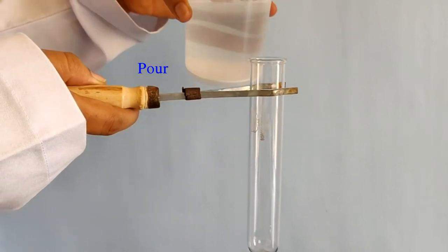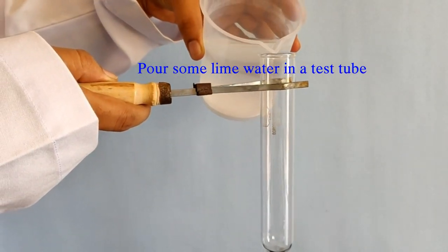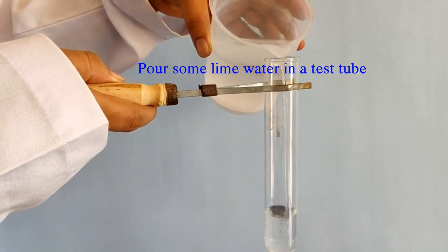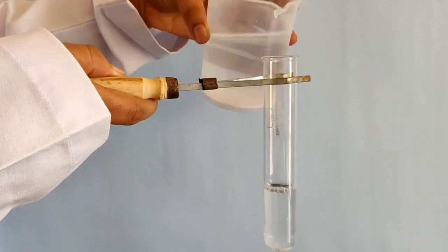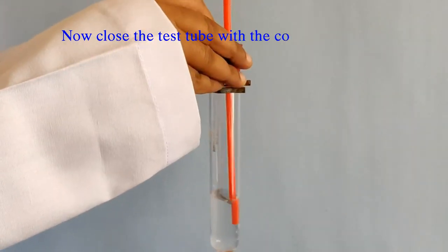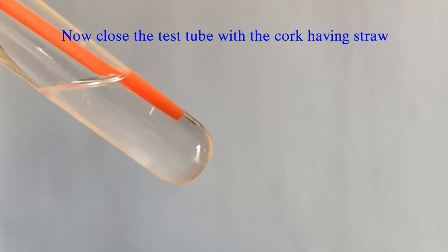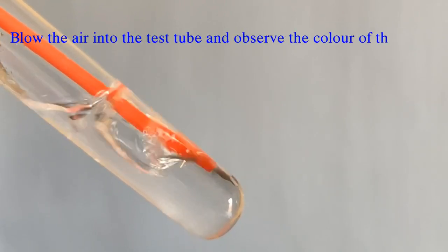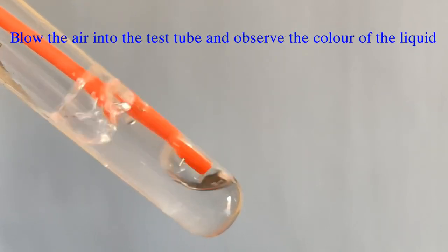The equation for this reaction is: CaO + H₂O → Ca(OH)₂. Now, pour some lime water in a test tube. Close the test tube with a cork having a straw, and blow air into the test tube.